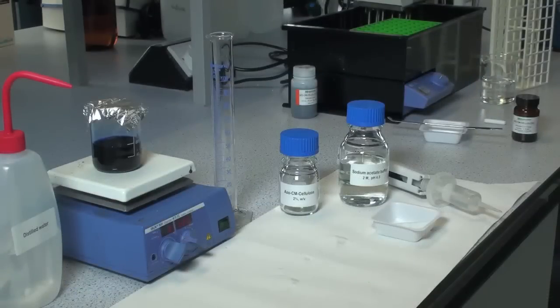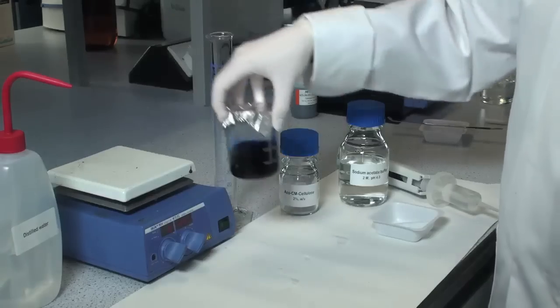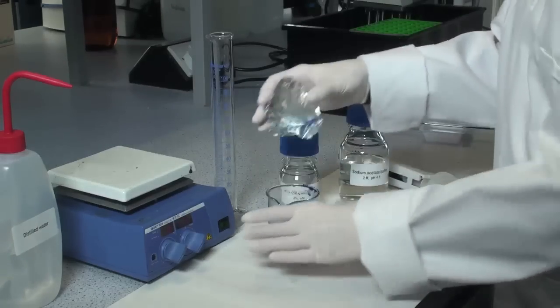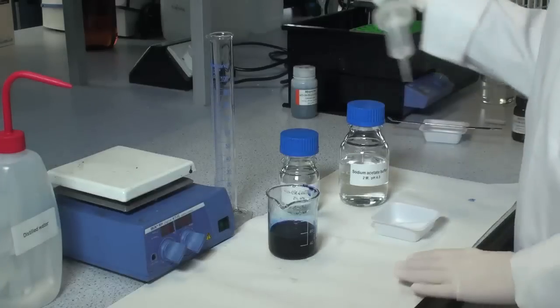Remove the beaker of substrate from the stirrer and add 5 mls of 2 molar sodium acetate buffer, pH 4.5.